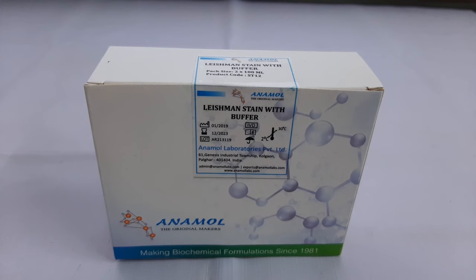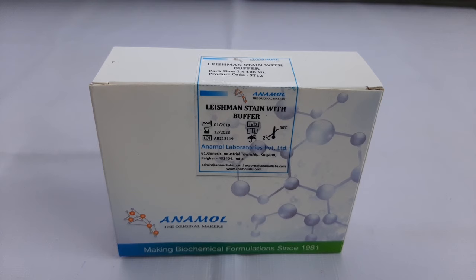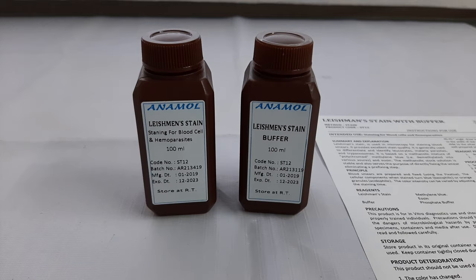Hello everyone. In this video tutorial, we will see the working and procedure of Leishman stain with buffer from the kit manufactured by Anamol Laboratories Pvt Ltd.